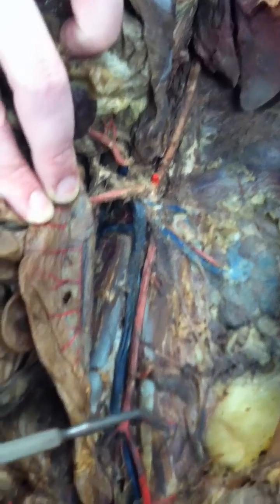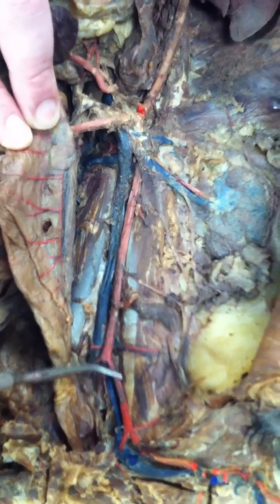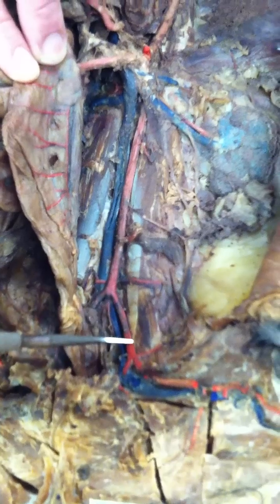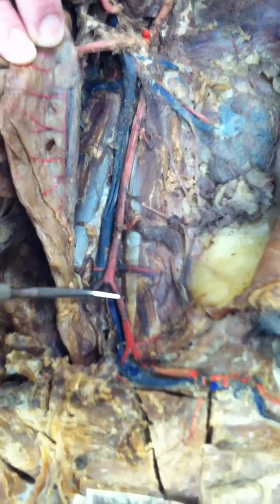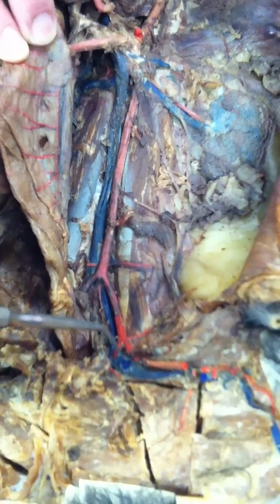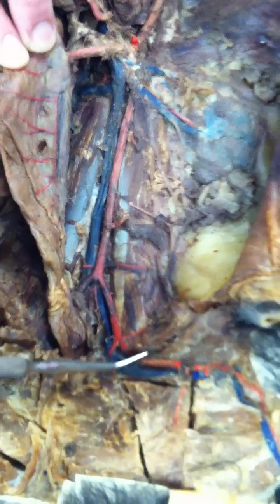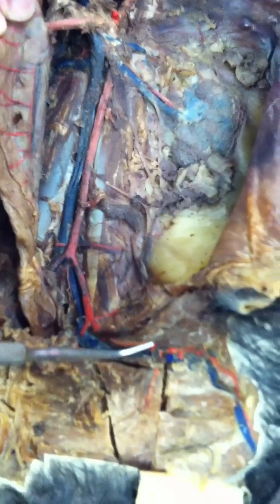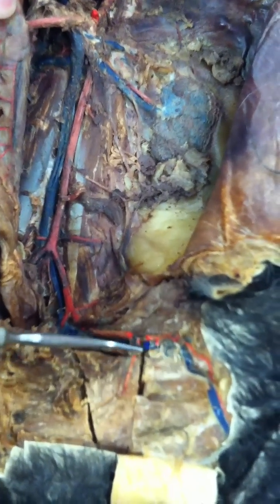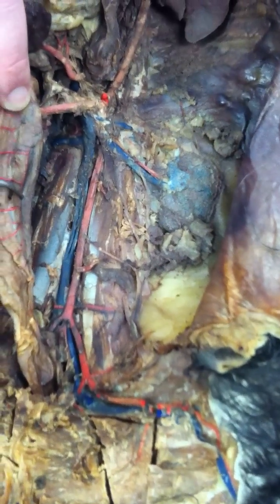Going back down, we have our gonadal arteries coming out the side and then the common iliac artery. The common iliac artery is going to become the external iliac artery and the internal iliac artery. The external iliac artery goes on to form the femoral artery of the thigh.